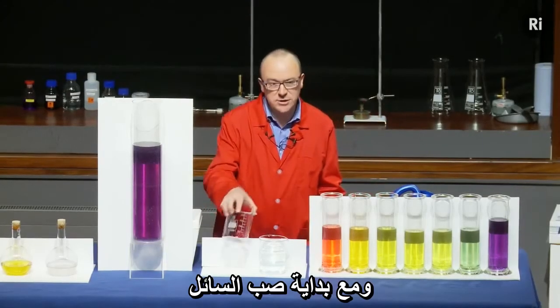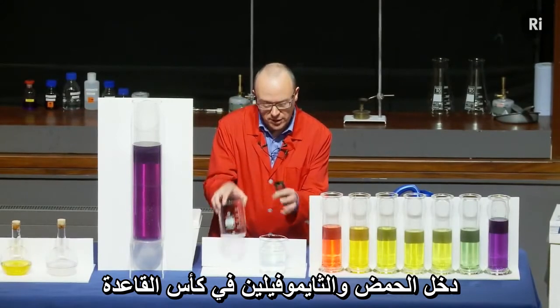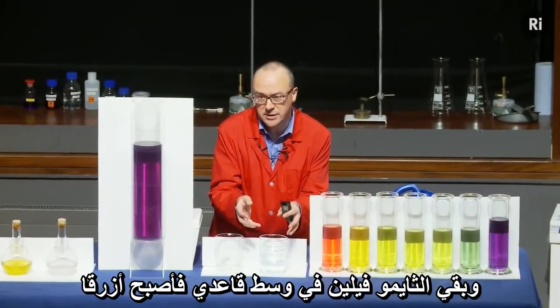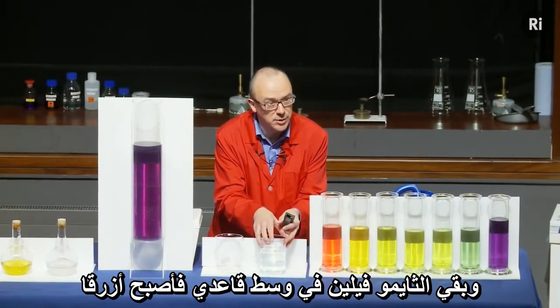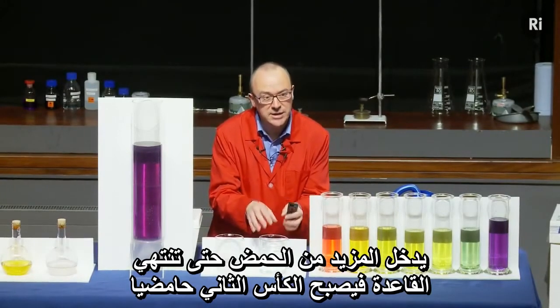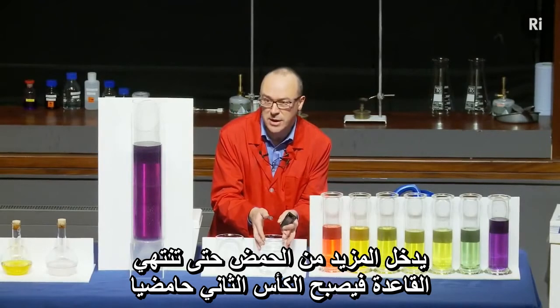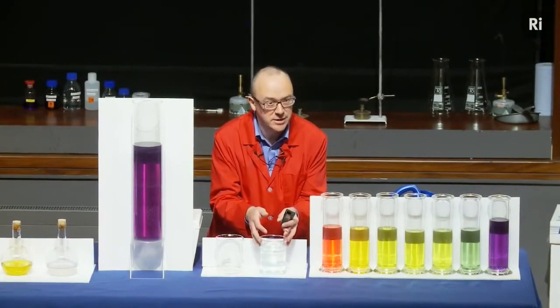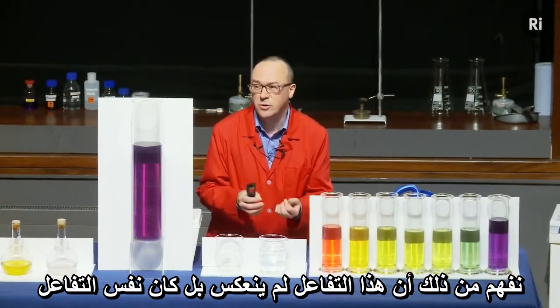As I started to pour the liquid, the acid and thymolphthalein went into the alkali, but the alkali quickly cancelled out the acid. So the thymolphthalein is now in an alkaline solution and it turns blue. But as I keep on pouring, I'm adding more and more acid, neutralising the alkali, and eventually the beaker becomes acid as well and the thymolphthalein goes back to being colourless. So this reaction was not going backwards — it was just the same reaction all along.